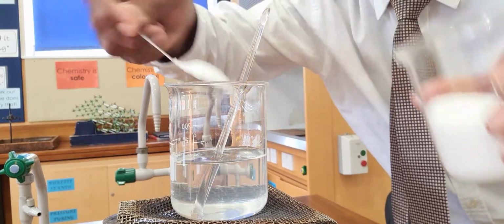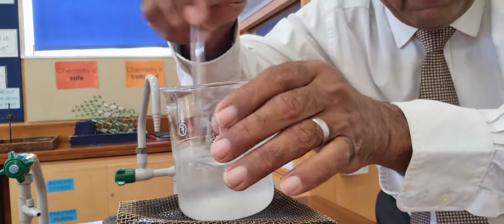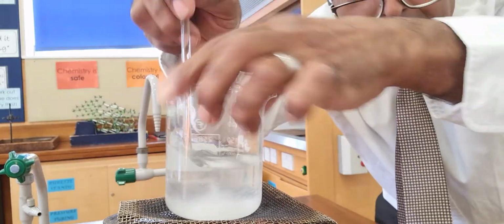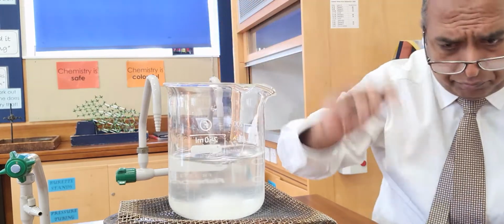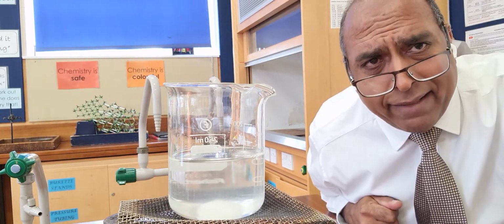If there are solid bits, that's 2 spoons of sugar, look, they stop the passage of light. And you can see that then it's murky, it's opaque, and the light doesn't go through. So I could stir that up again for a few minutes and get that sugar to dissolve.